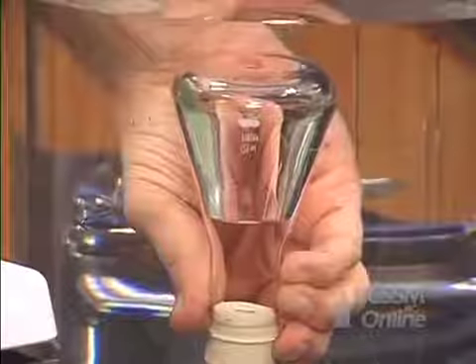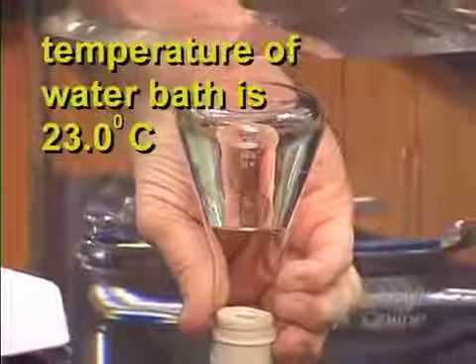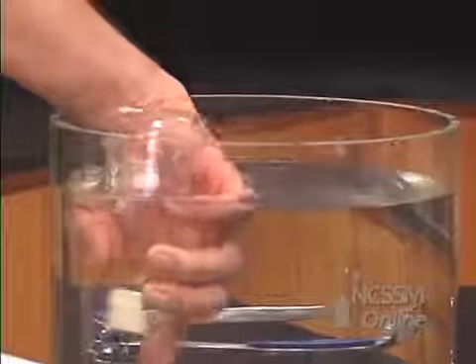Eventually, the air in the flask will come to the same temperature as the temperature in the large water bath. We will raise the flask so that the water level inside the flask and outside the flask are the same. This means that the total pressure in the flask will be the same as atmospheric pressure. I will now put my finger back over the tip of the stopper and remove the flask from the tank.